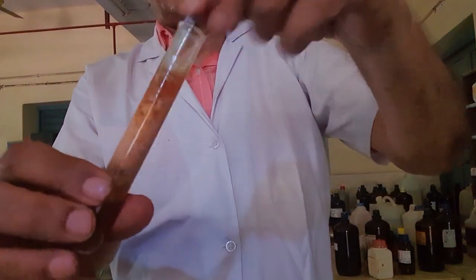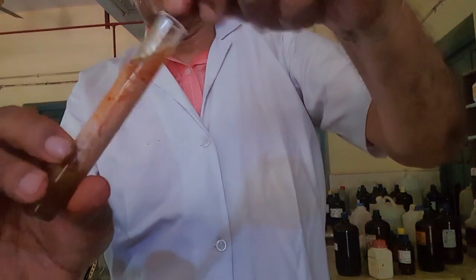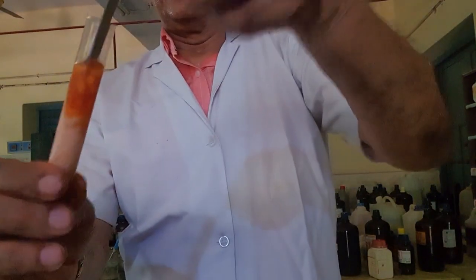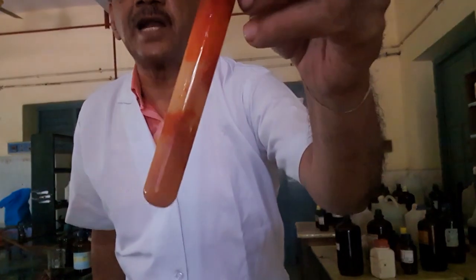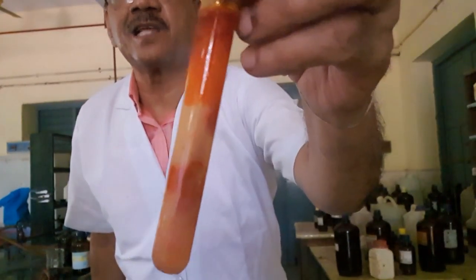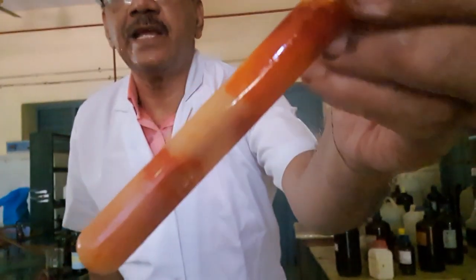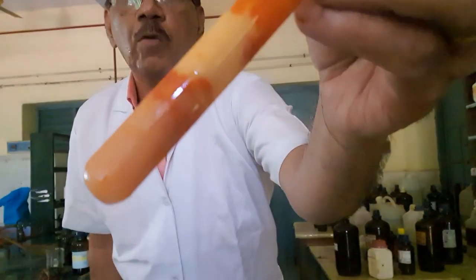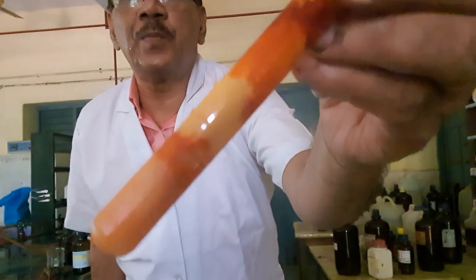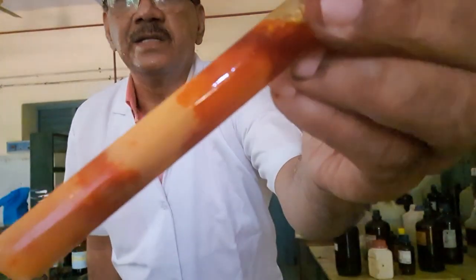Kindly just see that it is now forming the corresponding red dye. See, after stirring, the red crystals are settling at the bottom. Can you see? Red dye crystals are settling at the bottom. This we can filter and keep on the table. But when you are mixing this solution, it should be done at 0 degrees. That is the most important. See the red dye? Thank you.